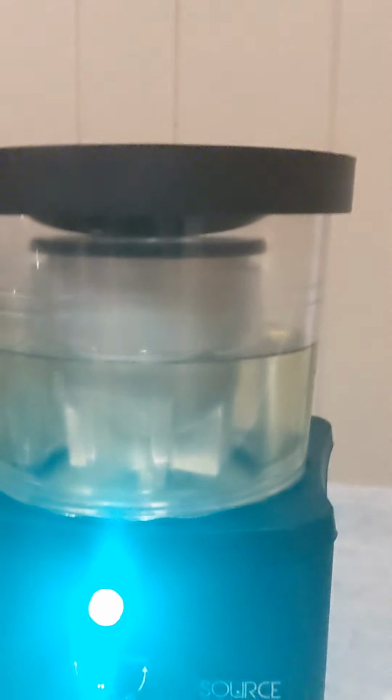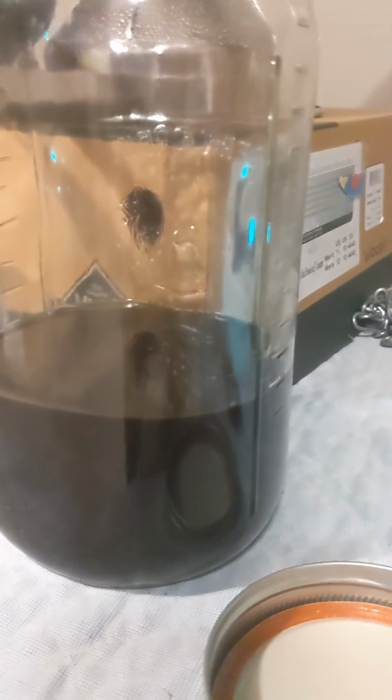Here it is. The chamber's almost full, the chamber of clean ethanol. I refilled this once with the liquid, which was a very long wash, so this is not a quick wash at all. That's why it's so dark. But you can see this is what went in. This is what's coming out. Whatever's going to be remaining in the pot at the end will be quite dark.